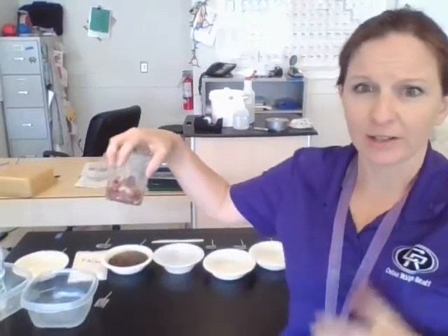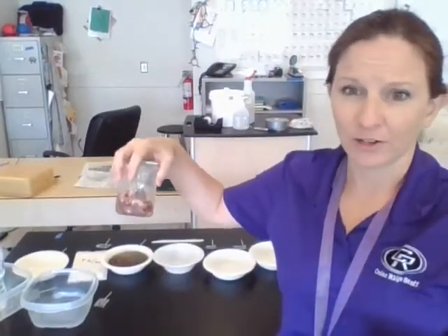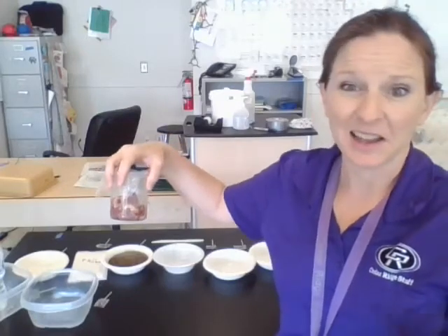All right, so chicken hearts — that's what we're going to try out today. We might have additional, a little bit bigger tissue we try next week. We'll just kind of see how it goes.